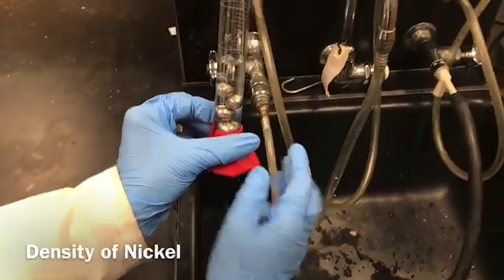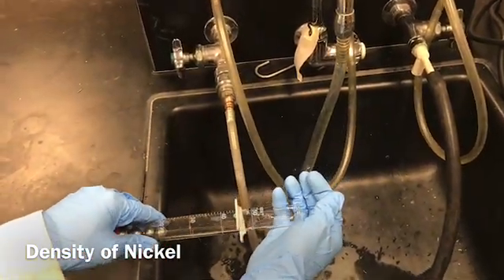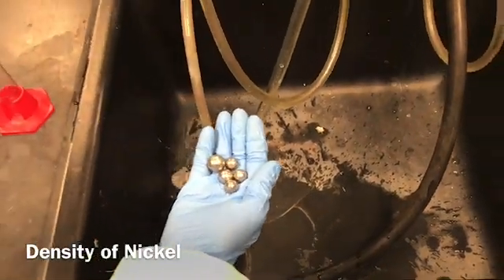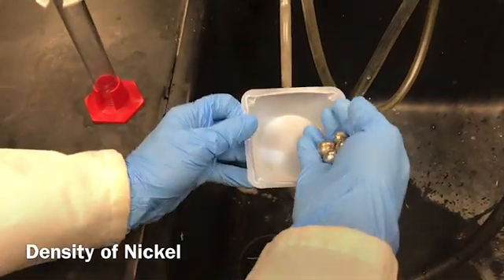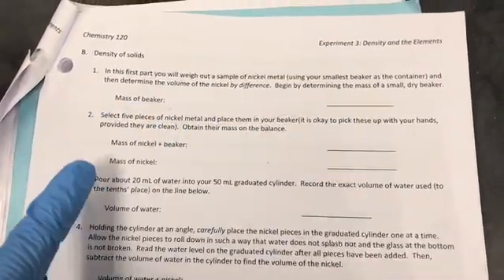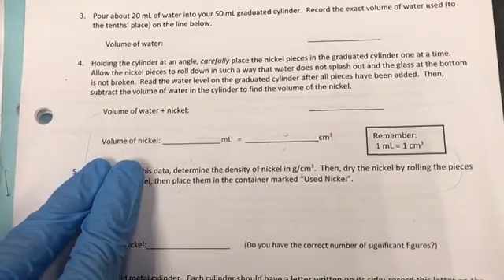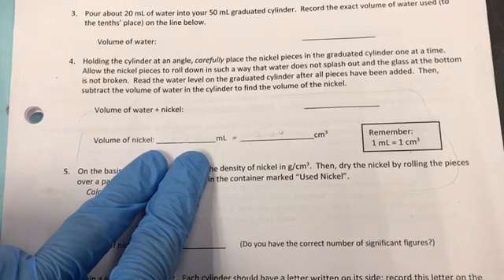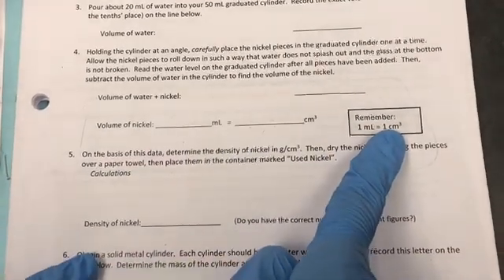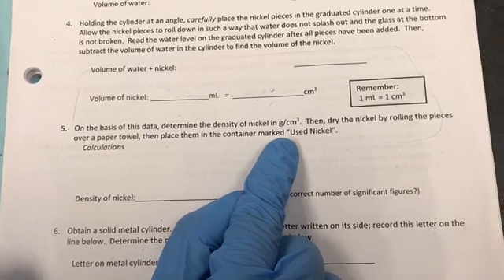When taking out the nickel spheres from the measuring cylinder, make sure your hand is in front to secure them — otherwise they might roll into the sink. Place them in the tray to save them. For calculations: record mass of the beaker, mass of nickel plus beaker, calculate mass of nickel by difference, and record initial volume of water. For the volume of nickel by displacement, read it in milliliters but convert to cubic centimeters. One milliliter equals one cubic centimeter. Density of solids is reported in grams per cubic centimeter, while density of liquids is in grams per milliliter.